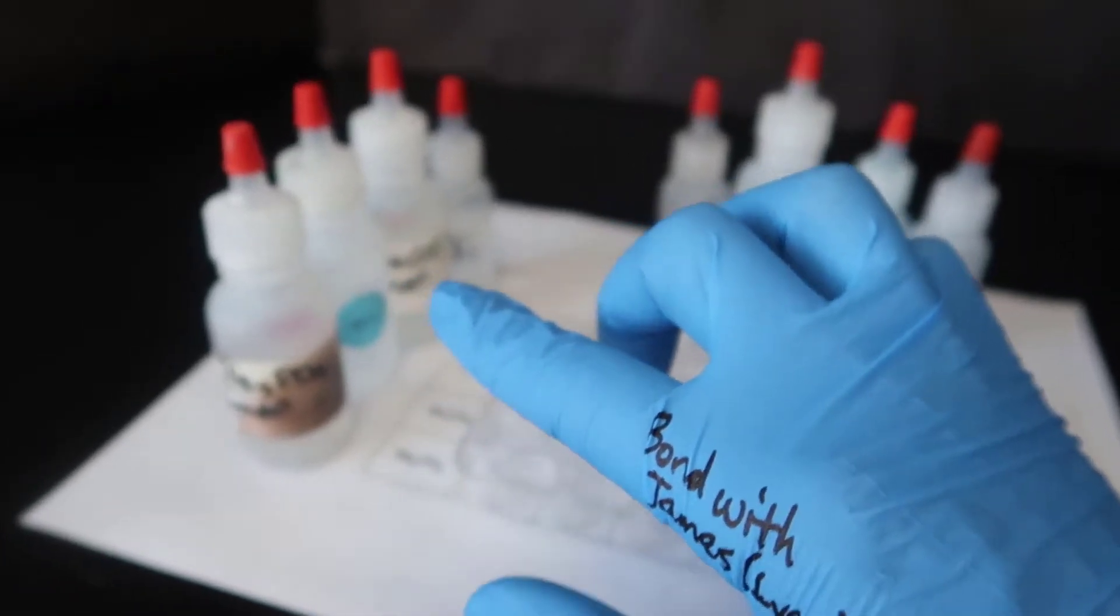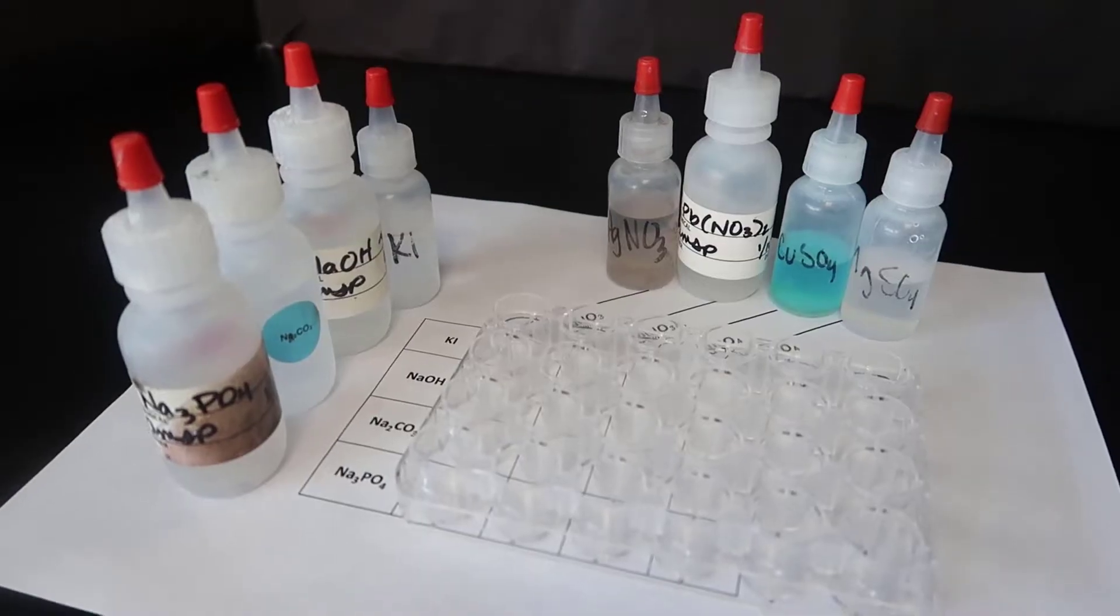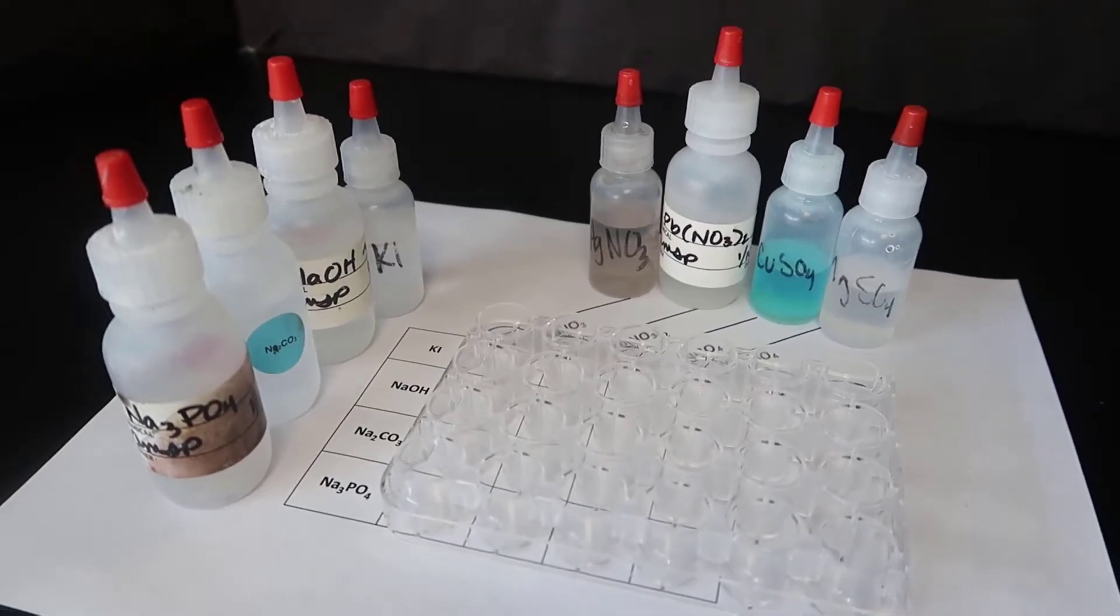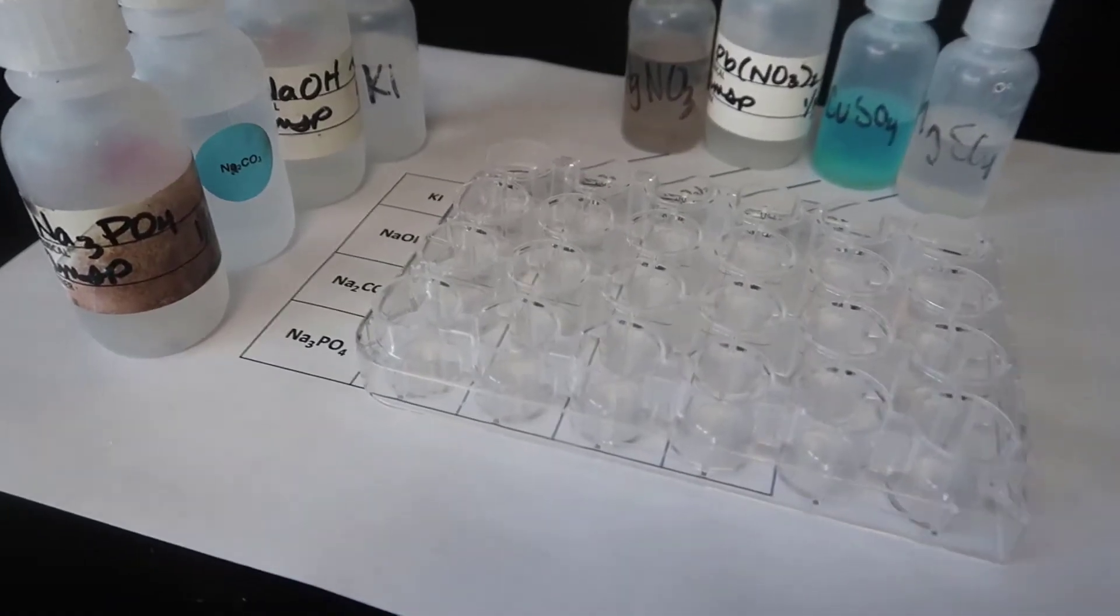In this lab, I am going to mix several ionic aqueous solutions, as you can see here. Now, I am not going to say the name because your teacher might want you to practice naming, and so I am just going to list out the symbols.